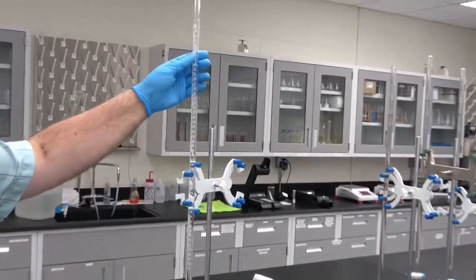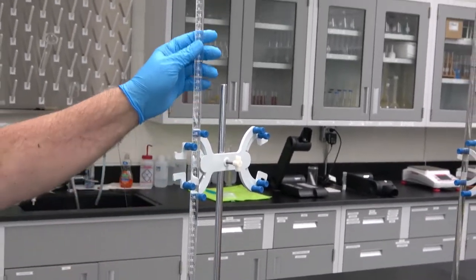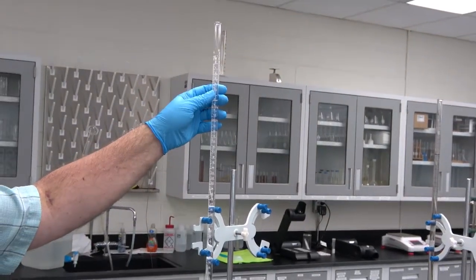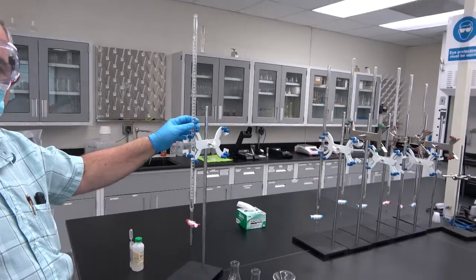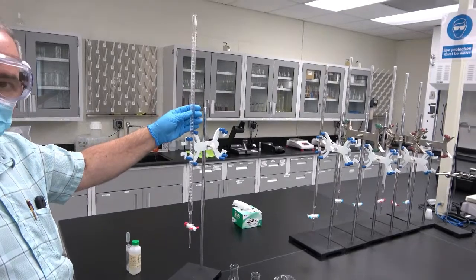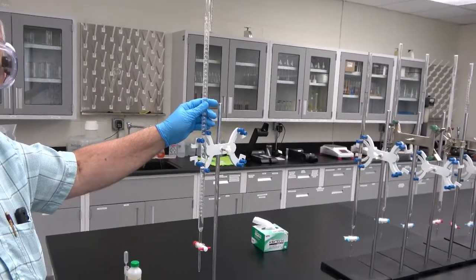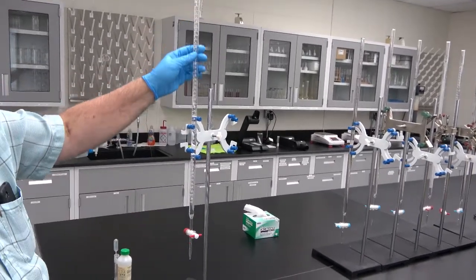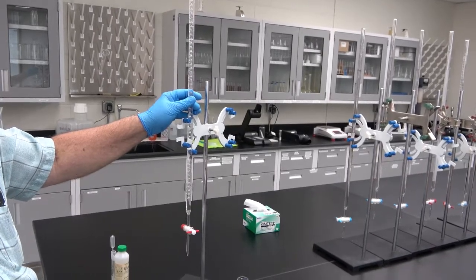So if we empty the burette and there is some water residue in the burette, when we put the sodium hydroxide solution, it is going to be diluted with the water that is in the burette. In order to avoid that, we use small portions of sodium hydroxide and let it pass through the walls of the burette to rinse out any residual water that may stay on it.